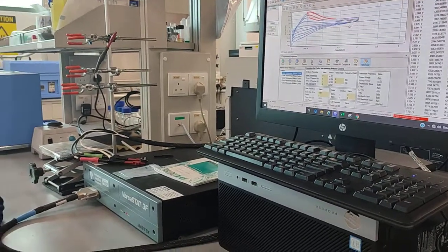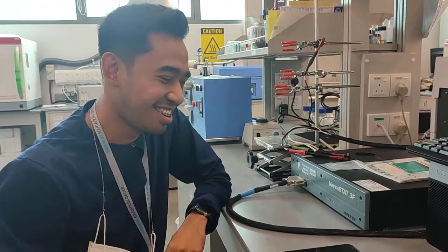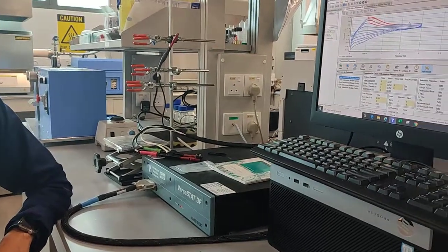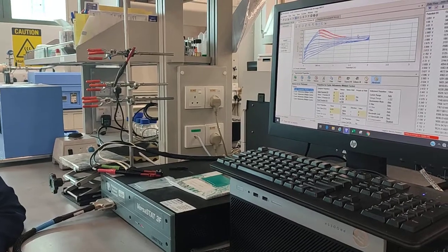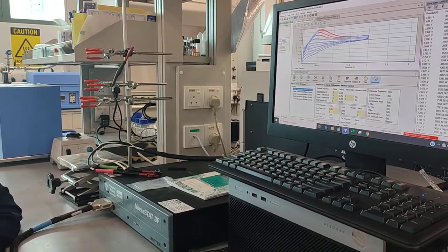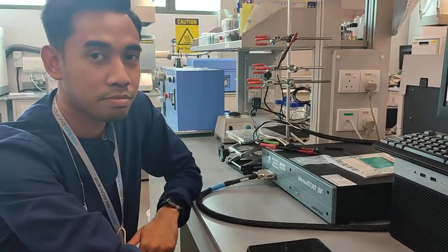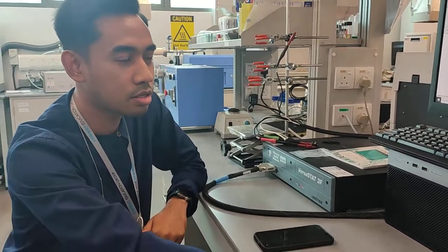So again, I would like to introduce you to Dr. Amirul Aizat. He would like to do an experiment to study the mechanism of the lithium, either it will be lithiation or de-lithiation. Can you explain a little bit about your procedure, in terms of what application and a brief description about this analysis?